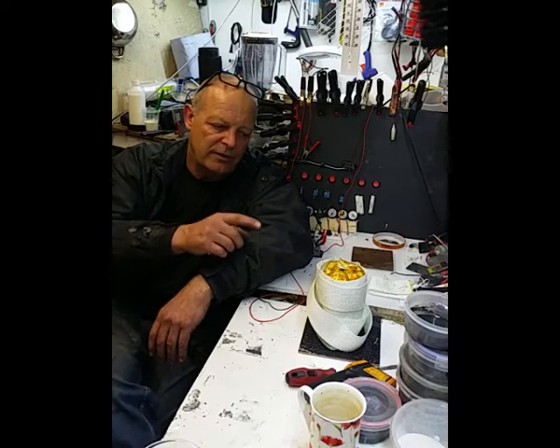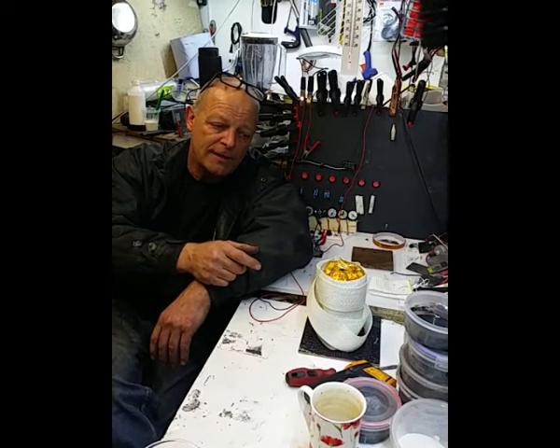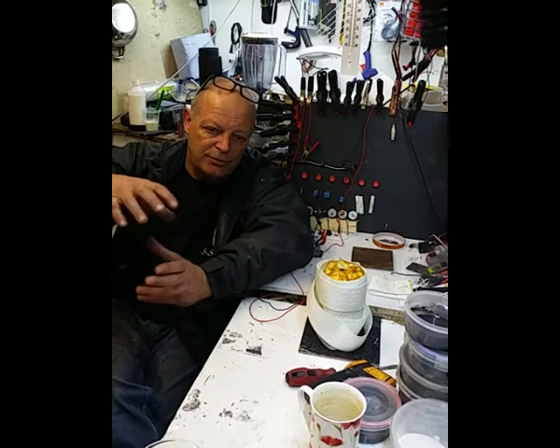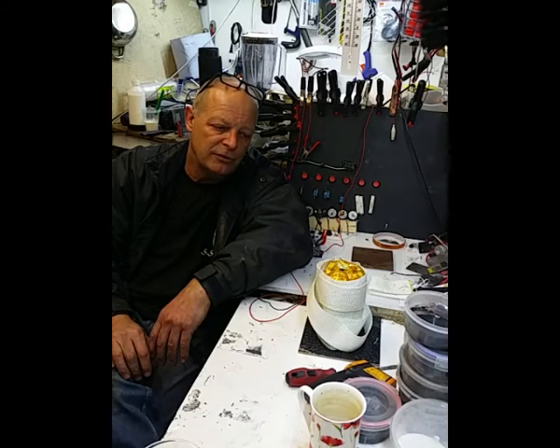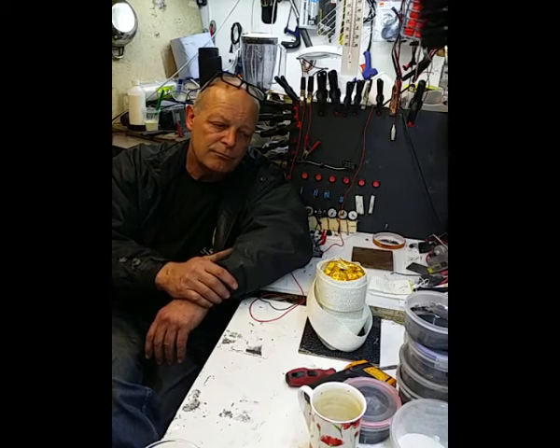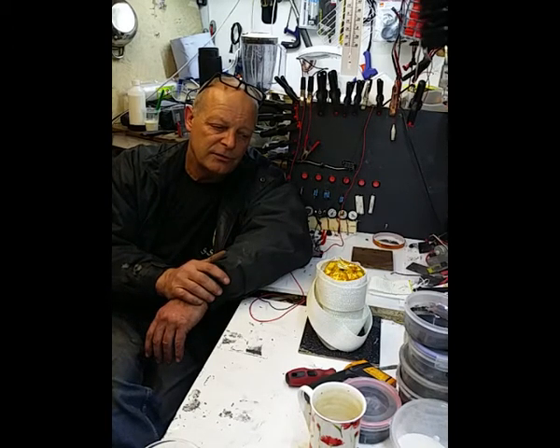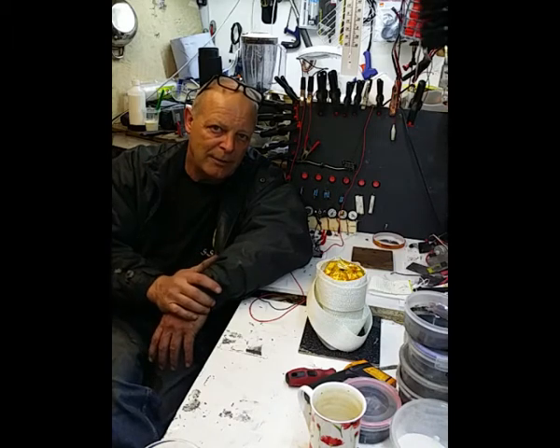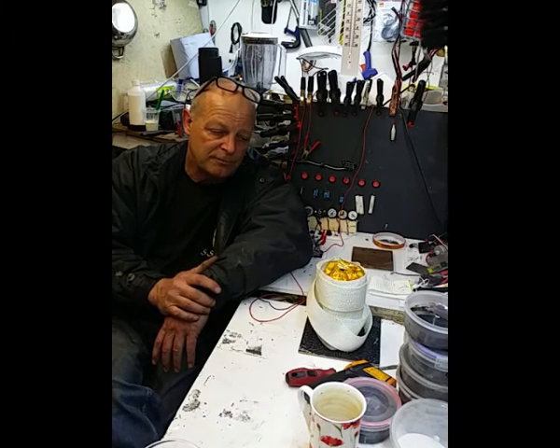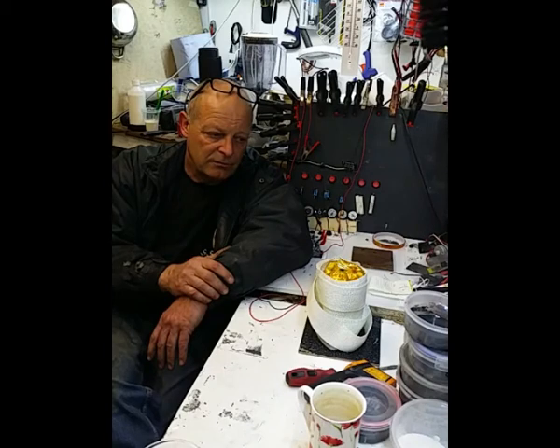The other thing I was thinking about with this was that if you wanted to put a cup inside of it, a Teflon cup, as you've got with the proper hydrothermal units, you know, the stainless steel autoclaves, you couldn't do it with this because that probe is in the way. So again, thinking cap time and work something else out, but as a basic idea I like it, so we shall see.